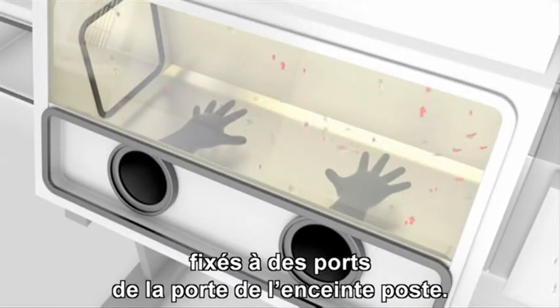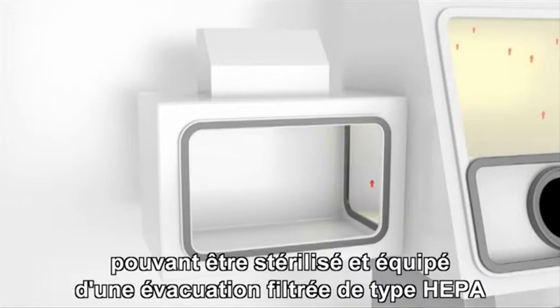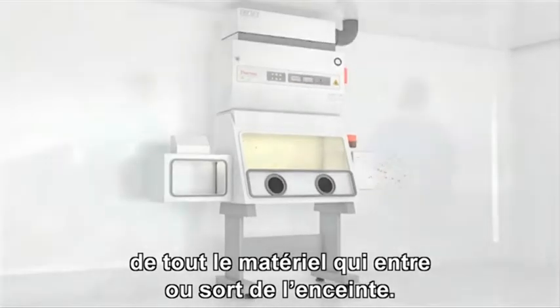Access to the work surface is by means of heavy-duty rubber gloves attached to ports in the cabinet door. The Class 3 cabinet has a pass-through box attached that can be sterilised and equipped with a HEPA-filtered exhaust, or a double-door autoclave can be connected for the decontamination of all materials entering or exiting the cabinet.